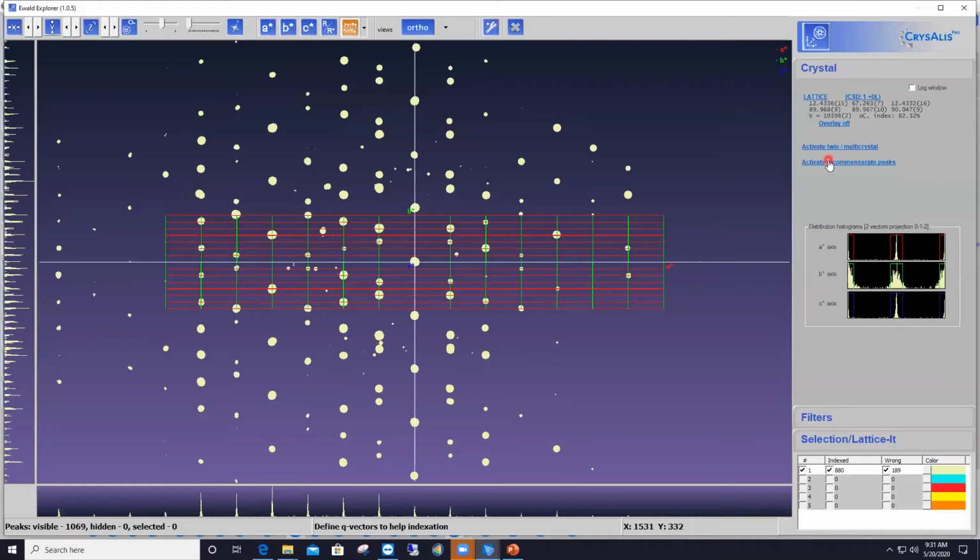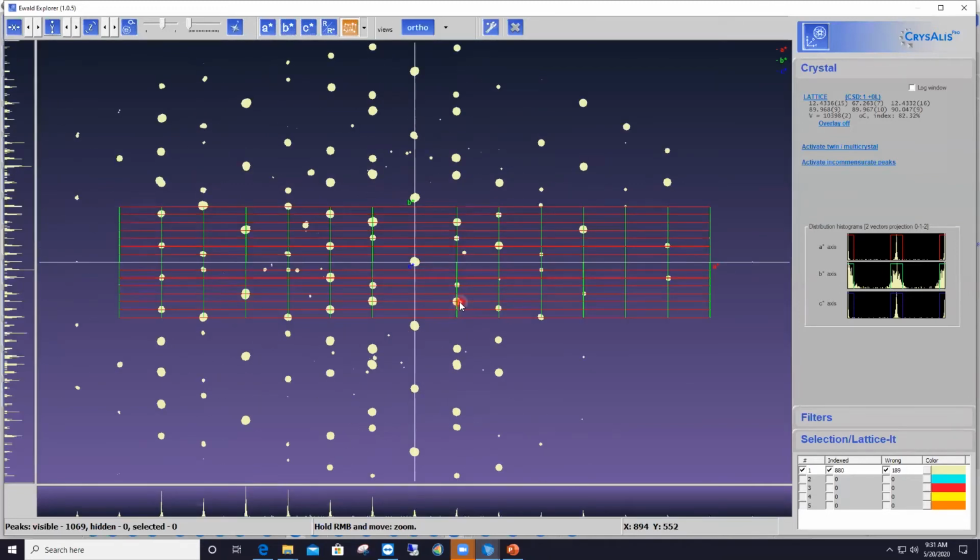So the B axis is the long one, 67 angstroms. On that display, B star is the vertical axis. You see that along the vertical axis, we have most of the reflections coinciding with the lattice points, thus the high percentage of reflections indexed. However, lots of lattice points are left empty, and that is wrong for indexing. I mean, this cannot be a correct indexing. You shouldn't have so many lattice points left unoccupied by reflections.